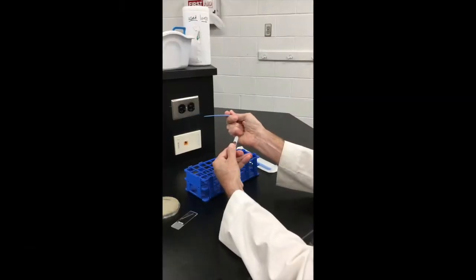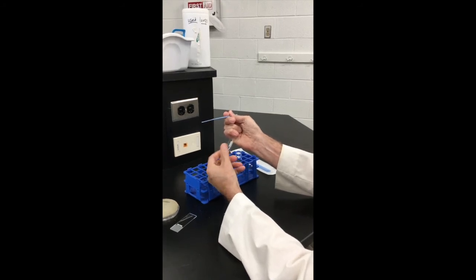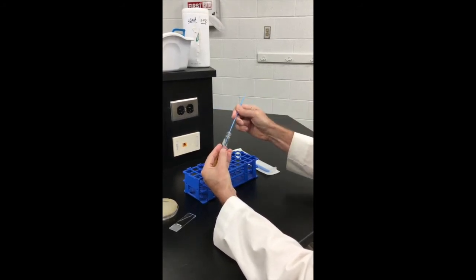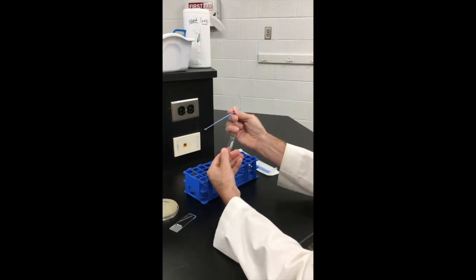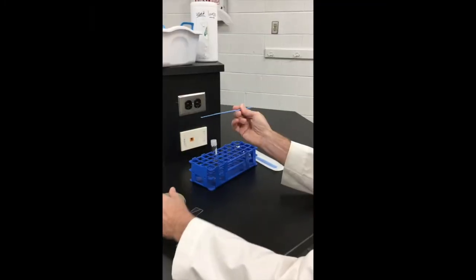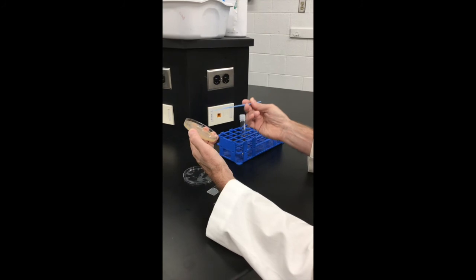If the destination is another tube, use the same procedure, opening the second tube after you have closed the original. You may also be inoculating a plate or preparing a slide for microscopy.